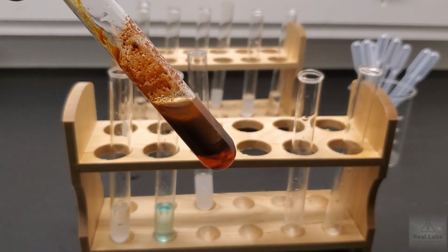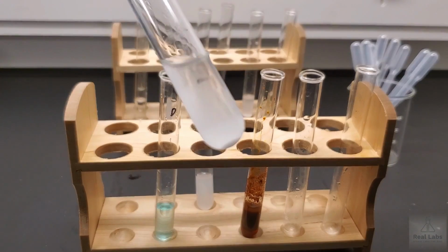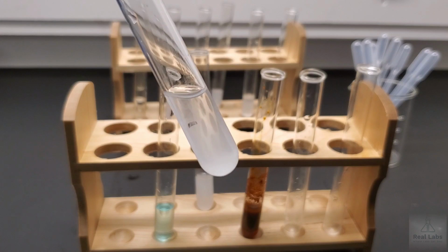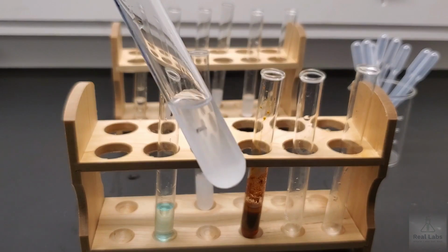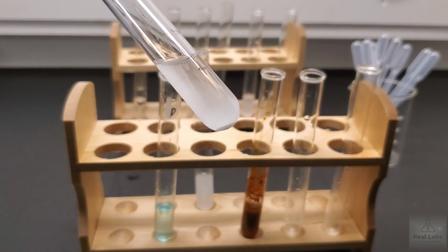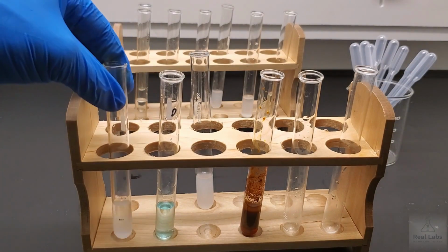In other cases where we had solid form, if I just pull one of those back up, you can look at that. You wouldn't just say a solid formed, you'd say what color the solid is and what color the liquid is that's around that solid. We refer to that as the supernatant. So that supernatant liquid in this case is clear, and what color is the solid? Sorry, it's colorless and clear. What color is the solid?